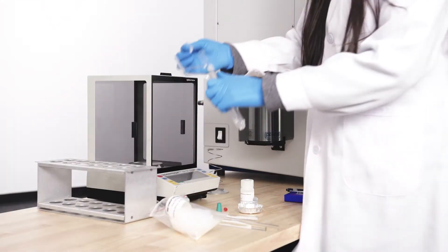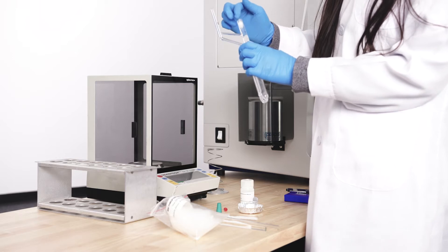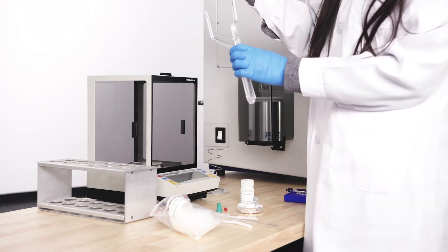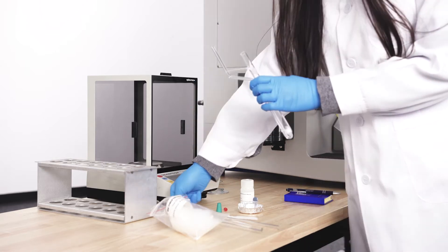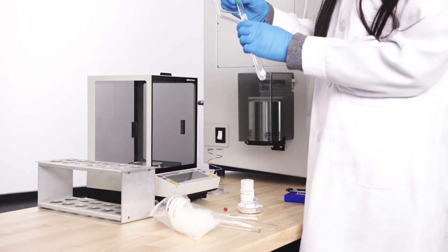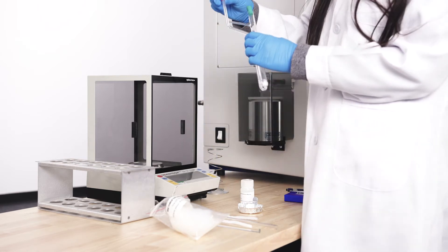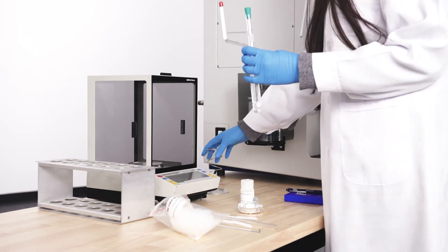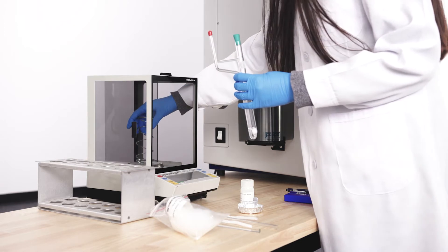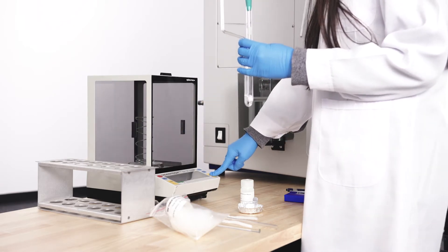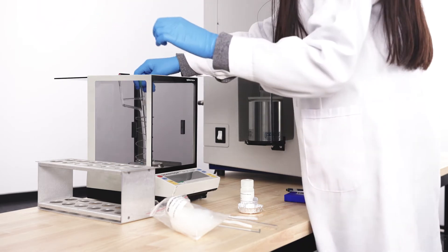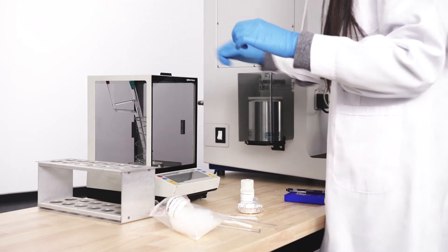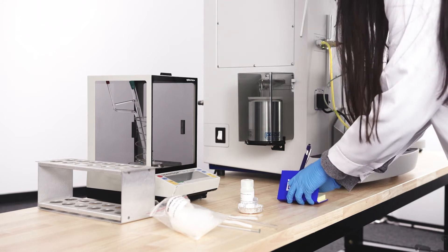Place a pinch of quartz wool at the bottom of the tube with the provided glass rod. Place the rubber stoppers on the inlet and outlet of the sample since calcium oxalate is hazardous. Weigh the sample tube with the rubber stoppers and quartz wool and use this mass as the empty sample tube mass.